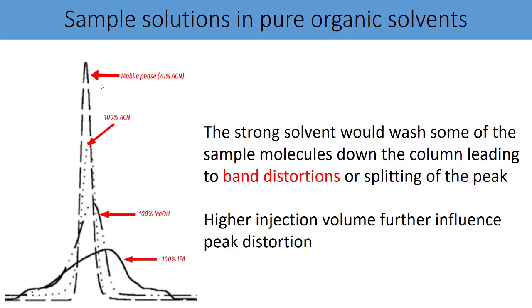If you use organic solvent or pure organic solvent as a diluent, you can see distortion in the peak shape, and the same can be seen on the screen here. You will see that the distortion is much more severe in the case of a stronger organic solvent like 100% IPA. The distortion of peak shape will also depend on the injection volume. The higher the injection volume, the higher the distortion in the peak shape. So this proves that the peak shape gets distorted because of the use of stronger solvent or pure organic solvent.